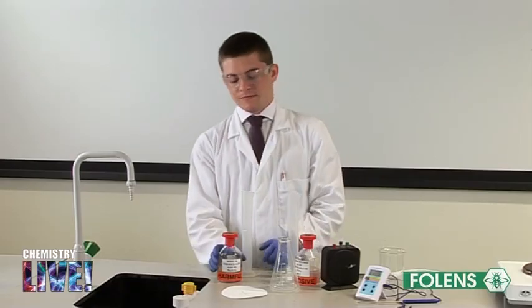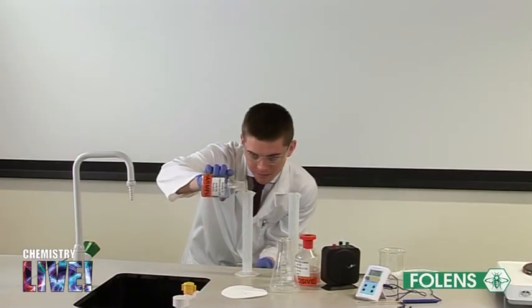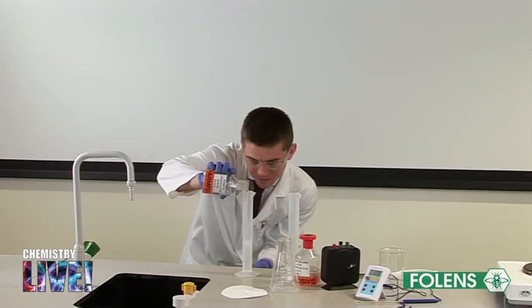Pour 100 centimeters cubed of a 0.05 molar sodium thiosulphate solution into a conical flask.